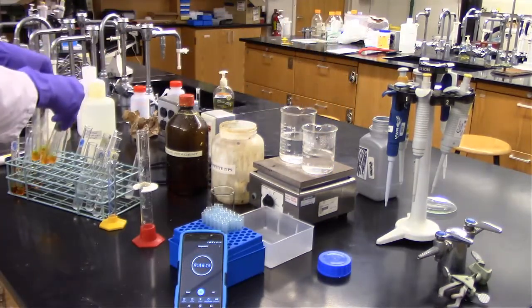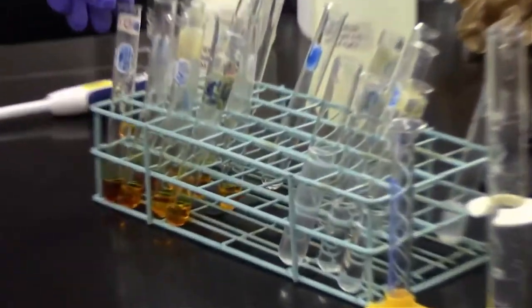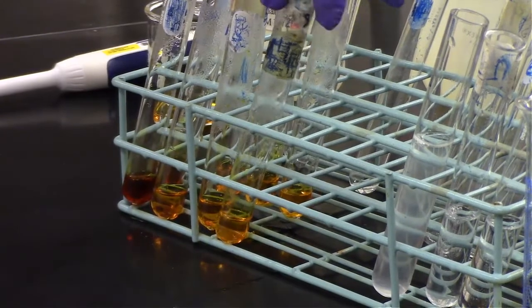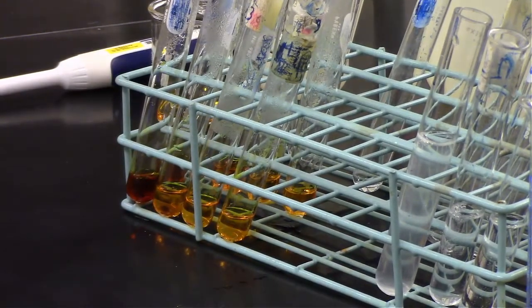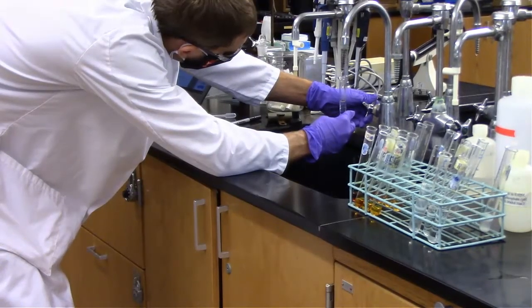Specifically, we had some sugars like maltose and/or glucose in solution that could react with that color reagent. That means some of the starch was actually broken down by my saliva. Now we just need to figure out exactly how much, based on those two dilutions.